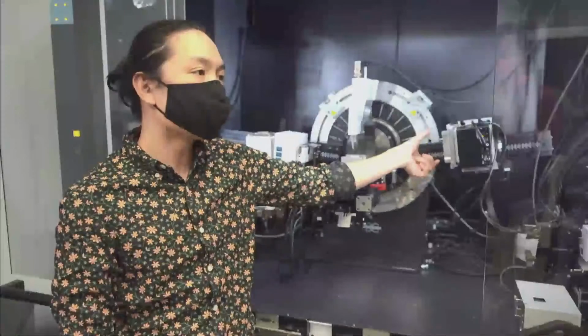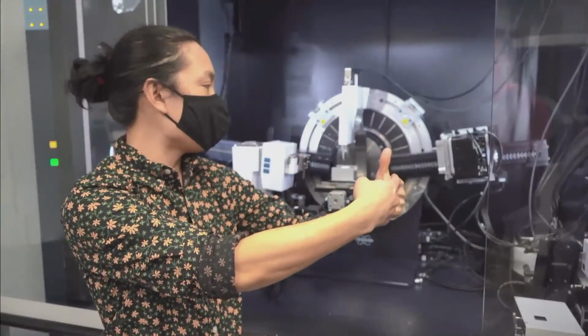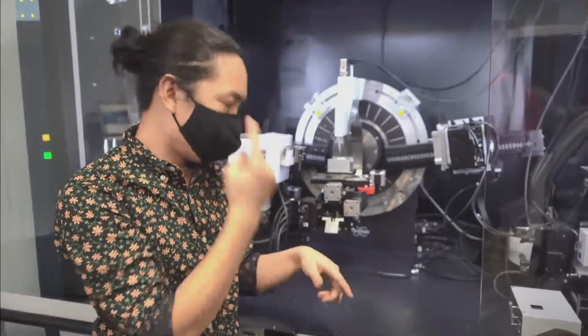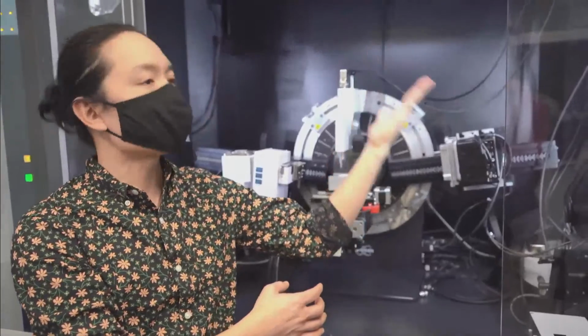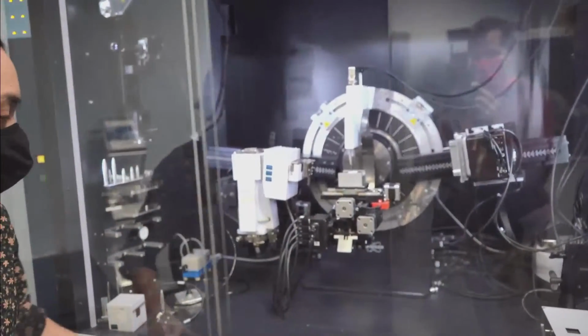So right now, this is set at a very big 2 theta coverage, which means that I'm able to collect at this distance about 14 or 15 degrees of data at one time. Oh, wow. Just in a snapshot. In a single snapshot, right? But we're actually going to use this in a scanning mode, which is going to move the detector up. It's going to move the source up. Traditional Bragg-Brentano scans. All right, let's head on over to the computer and see that in action.